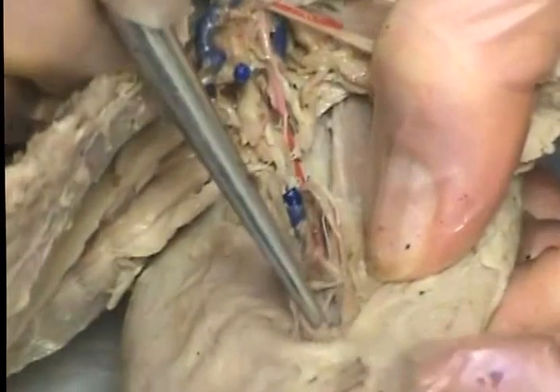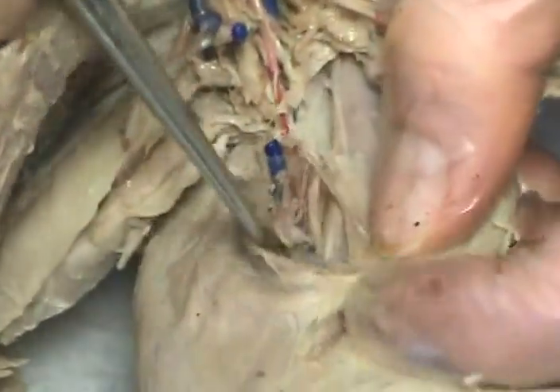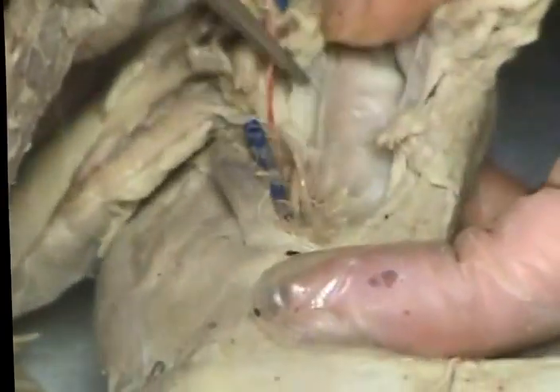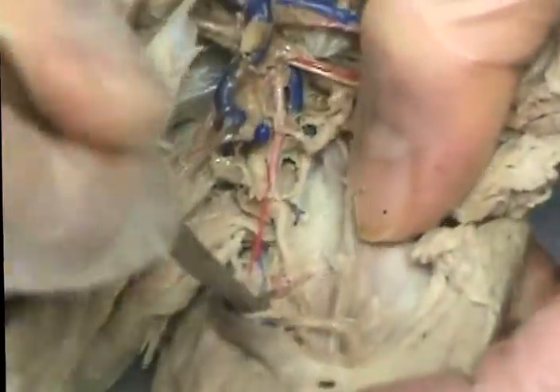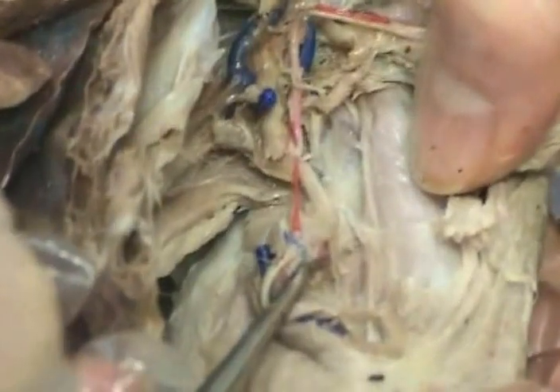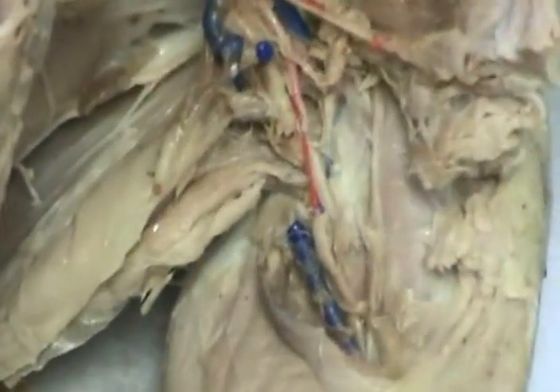guys didn't dig far enough up on your arm. Before we get to the radial and ulnar, there should be another branch. Oh, here it is. This is the anterior humeral circumflex artery and vein. That's the upper. Oh, now we gotta do arteries.